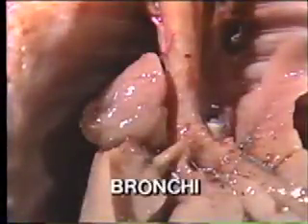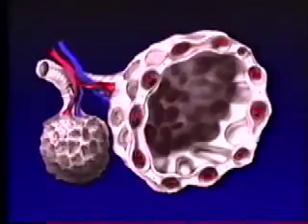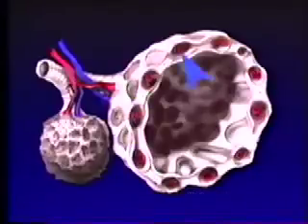The trachea branches into two tubes, the bronchi, before entering the lungs. Inside the highly vascularized lungs, the bronchi further divide into many bronchioles, which finally terminate in microscopic air sacs known as alveoli. Capillaries lie adjacent to the thin-walled alveoli. The actual exchange of oxygen and carbon dioxide occurs in the alveoli.